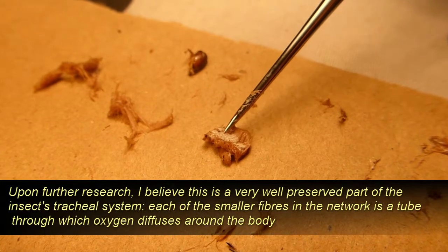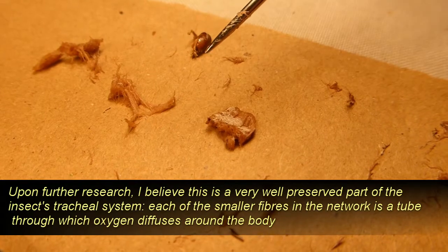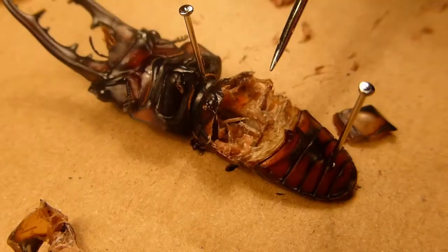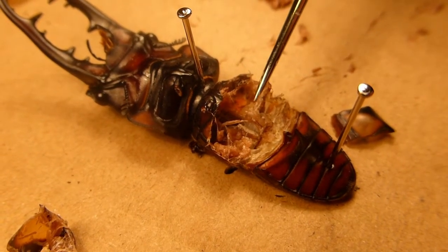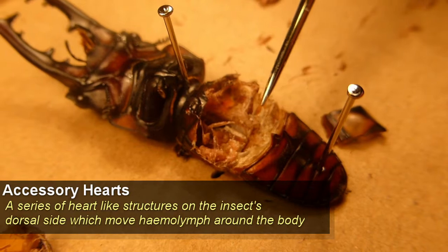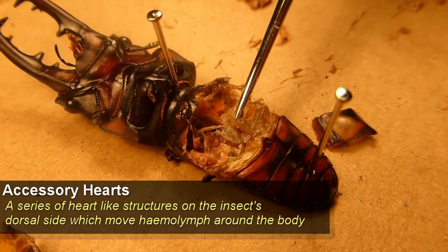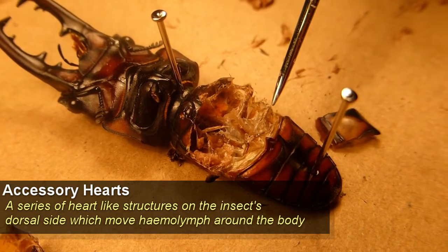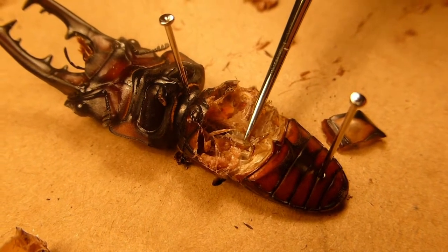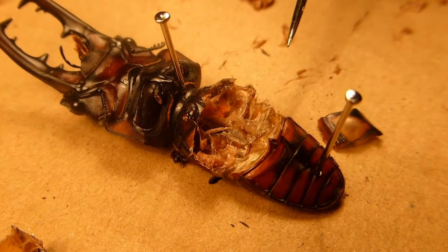There's an interesting fibrous pattern here — I'm not entirely sure what this is, but it looks to be a fine mesh network of some kind of organ. Looking back into the main body of the beetle, these dark structures at the very top — the dorsal side, the insect's back of the thorax — I suspect are the accessory heart structures. Insects don't have a closed circulatory system with veins, arteries, or blood vessels. Instead, they pump haemolymph around the body, and these structures at the back are what pump the haemolymph around and allow oxygen to diffuse through it.